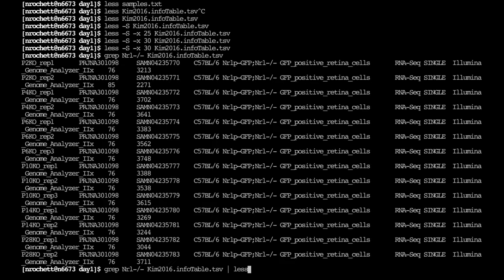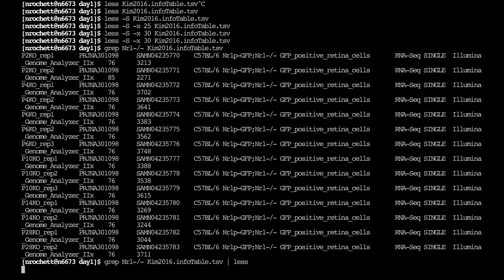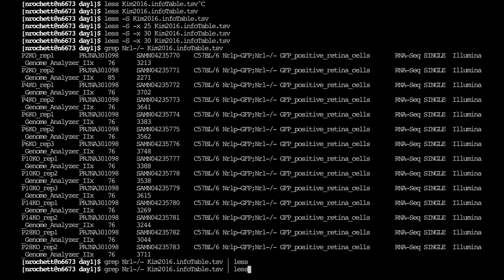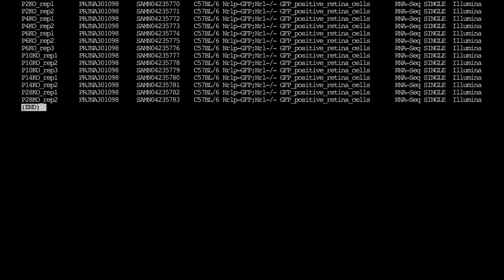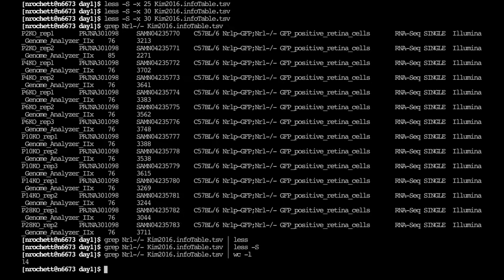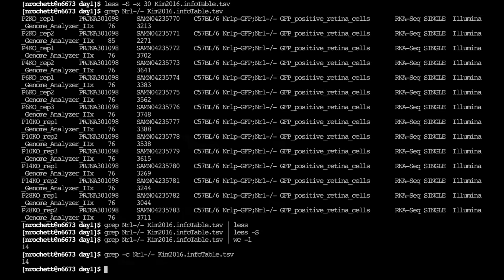So this one command here is a compound command with two commands in it, with a pipe in the middle, and so it takes the output of the first command and gives it to the second command, and then the second command executes. So here, this is less, and this is our output from grep. And again, we can just put it on a single line. And now all of our lines, they're all the lines that have the NRL minus minus. And again, we can do just counting the lines. These are 14 lines, so that would be 14 out of 30 samples. We can also, there's like 50 ways to do it. We can also just count the number of matching lines, which is also 14.